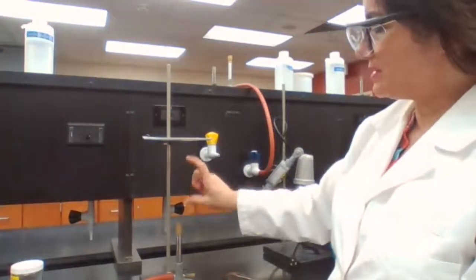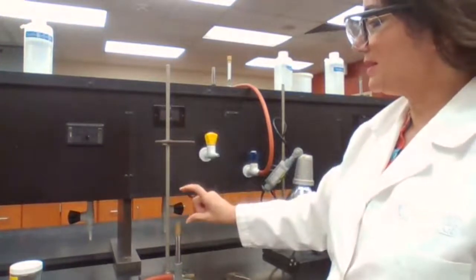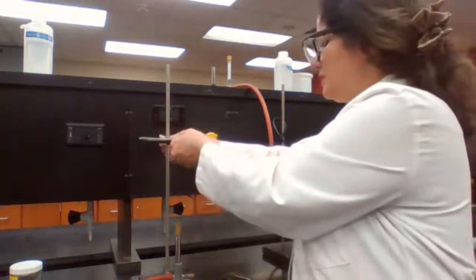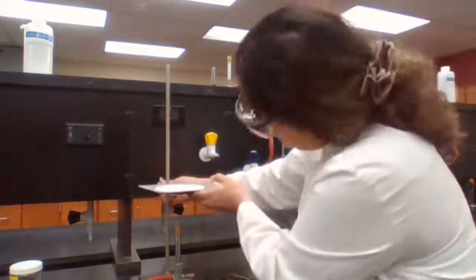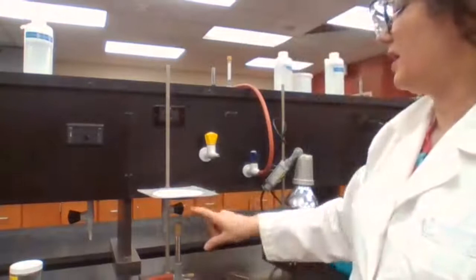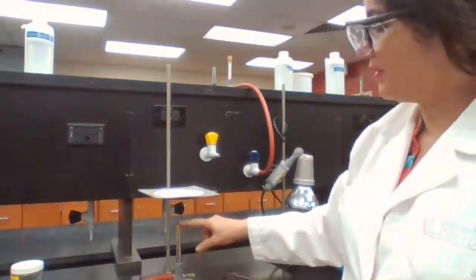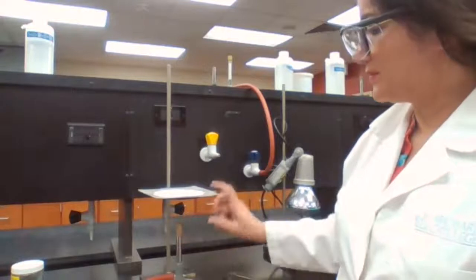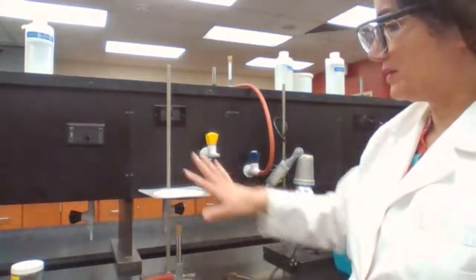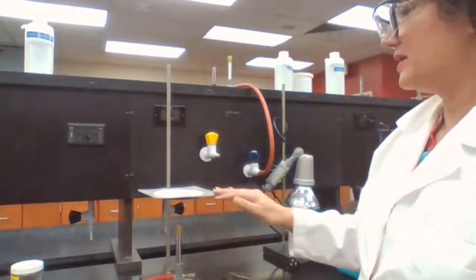So I try to adjust the height of the flame to about 2 inches. The iron ring should be about 2 inches higher than the base of the flame or tip of the Bunsen burner cylinder. So that's how the Bunsen burner is set up when you are using the wire gauze.